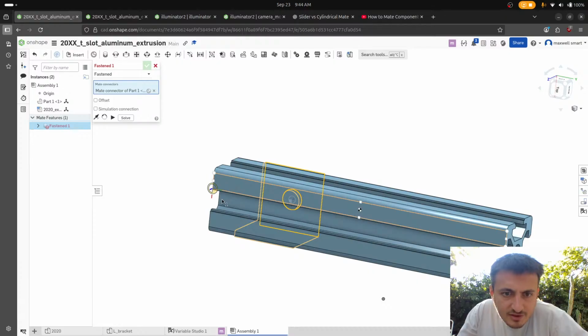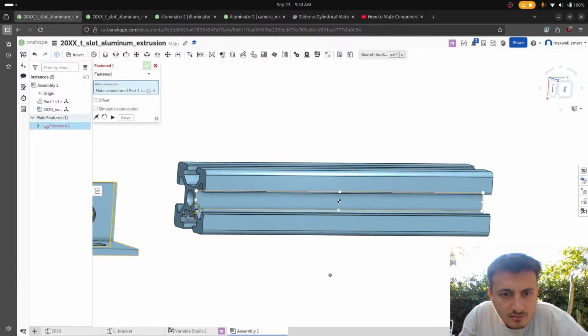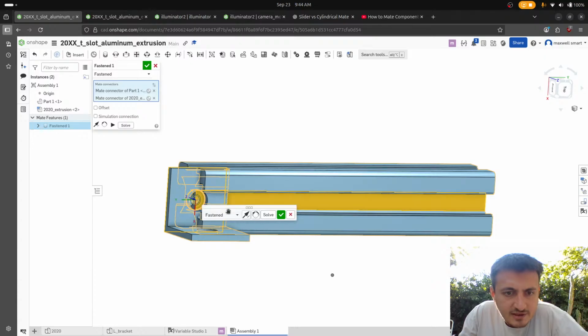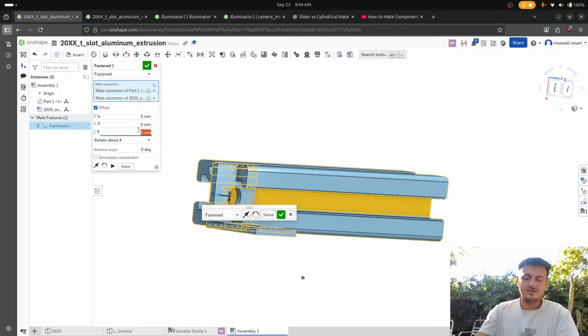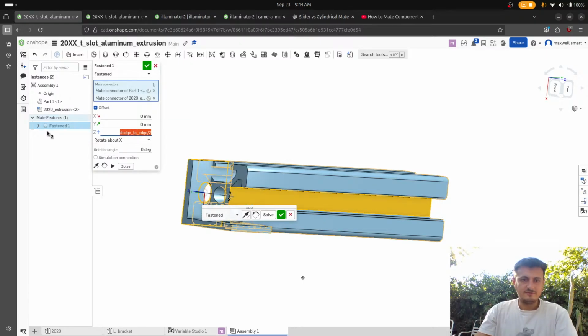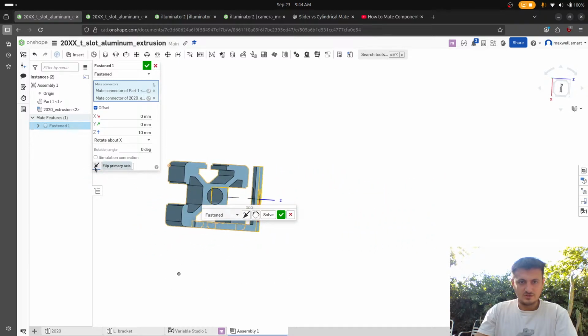Did he show how to put it in an assembly? Because that didn't help me at all. But if I did this, and then I just offset it by, let's see, Z is this way. This would be the edge to edge over 2. And then flip it. Not flip that.